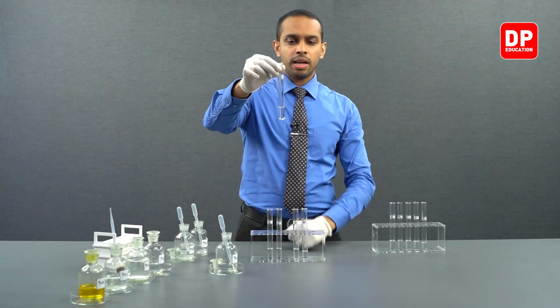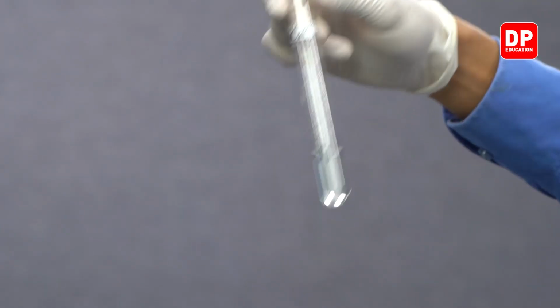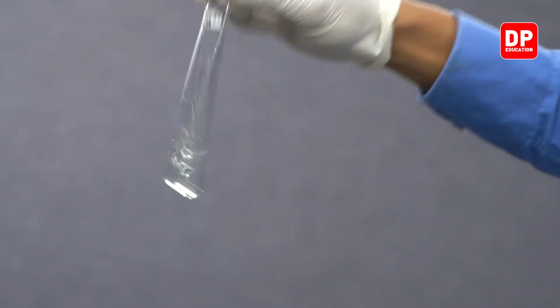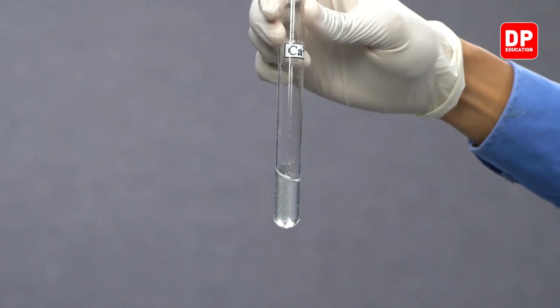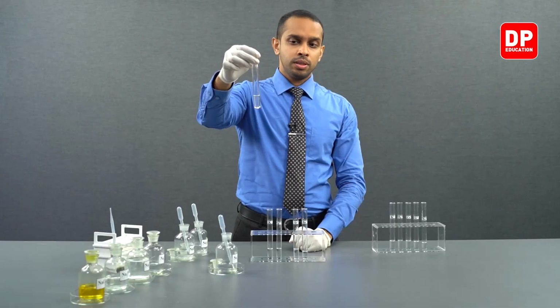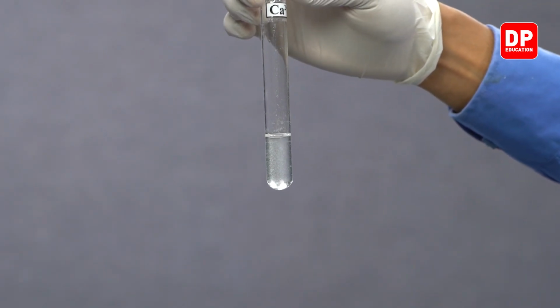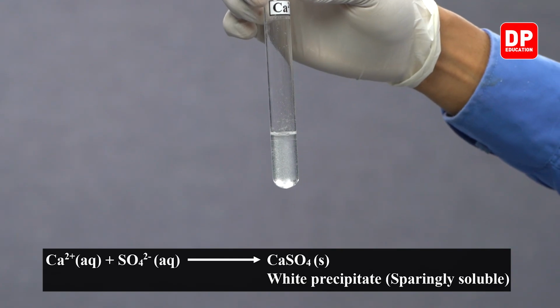When we add sodium sulfate to calcium 2 plus aqueous ion solution and mix it, the calcium 2 plus ions come into contact with the sulfate anion. Calcium 2 plus and sulfate anions together will form calcium sulfate.